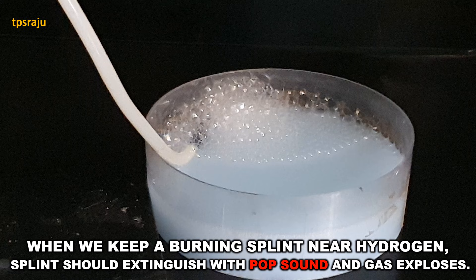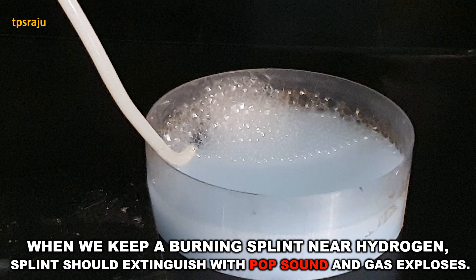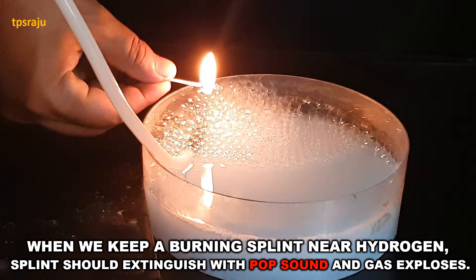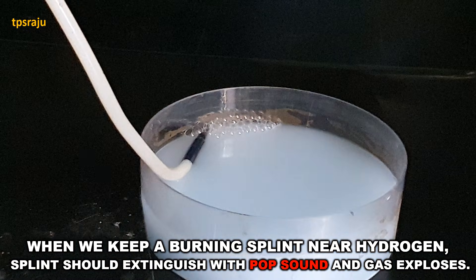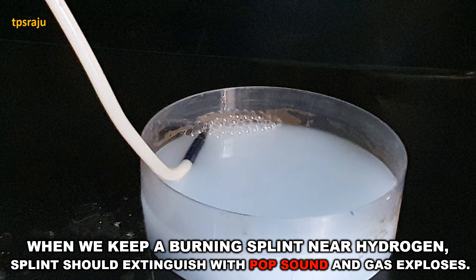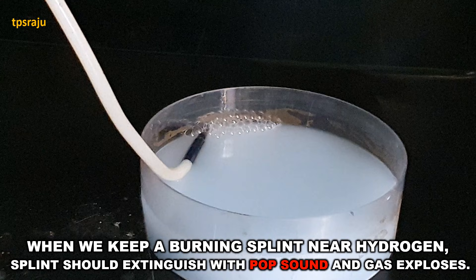This gas is captured as gas bubbles by using soap water. Now we are going to keep a burning splint near the gas bubbles. Observe carefully what will happen — the gas explodes with a pop sound. This indicates that the gas is hydrogen.